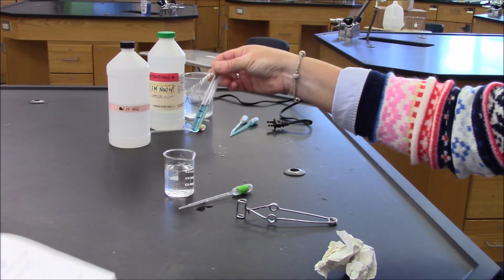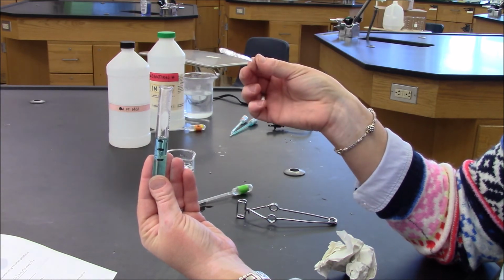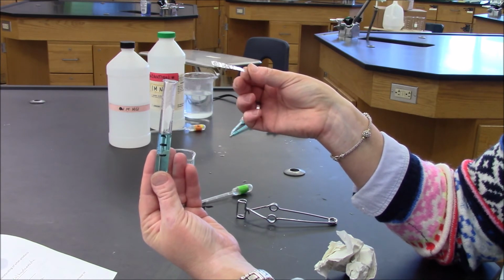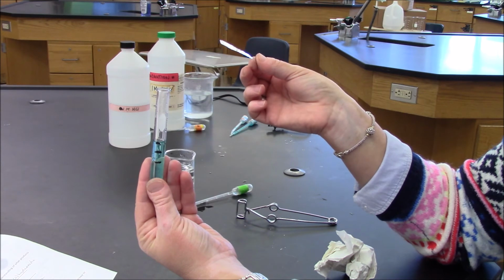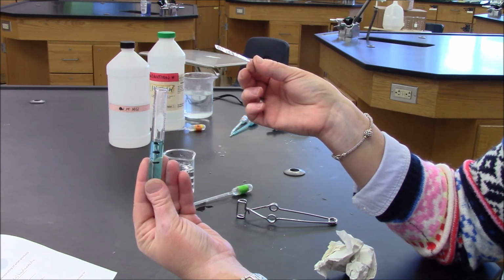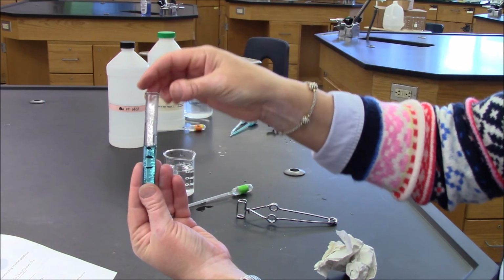For our last reaction, what we're going to be doing is actually observing two things. One, when I add this aluminum foil, the aluminum foil is going to react with the copper ions that are in this solution, and it's the copper ions that give it its color. Another thing that's going to react is the hydrochloric acid that I added. There was too much of it. So there's going to be what we call an excess, or some hydrochloric acid left over that didn't react with the black solid. When it reacts with this metal, we'll observe bubbles. All right.